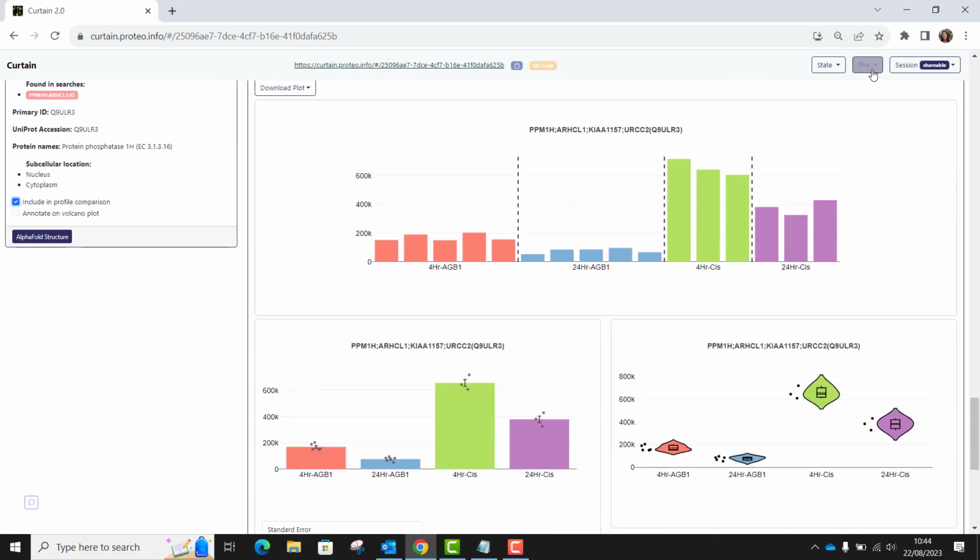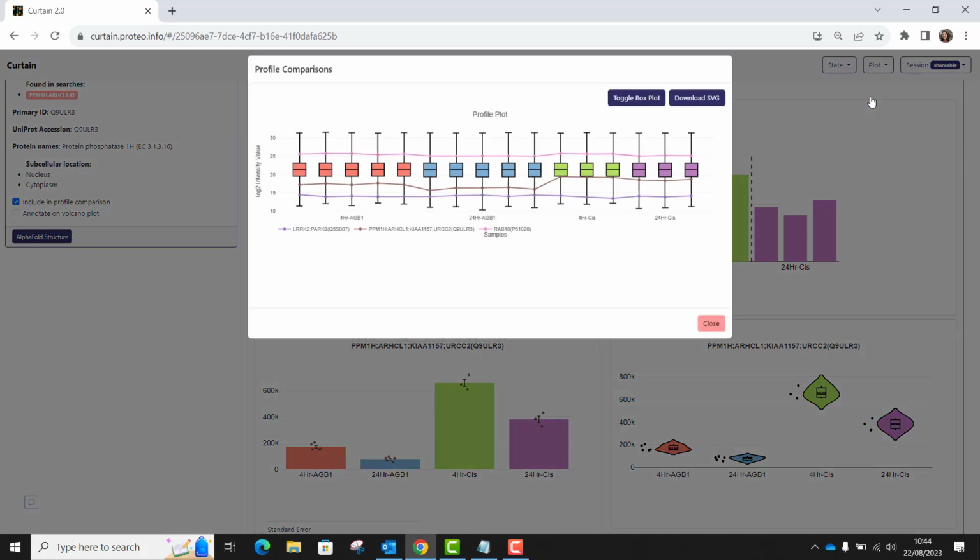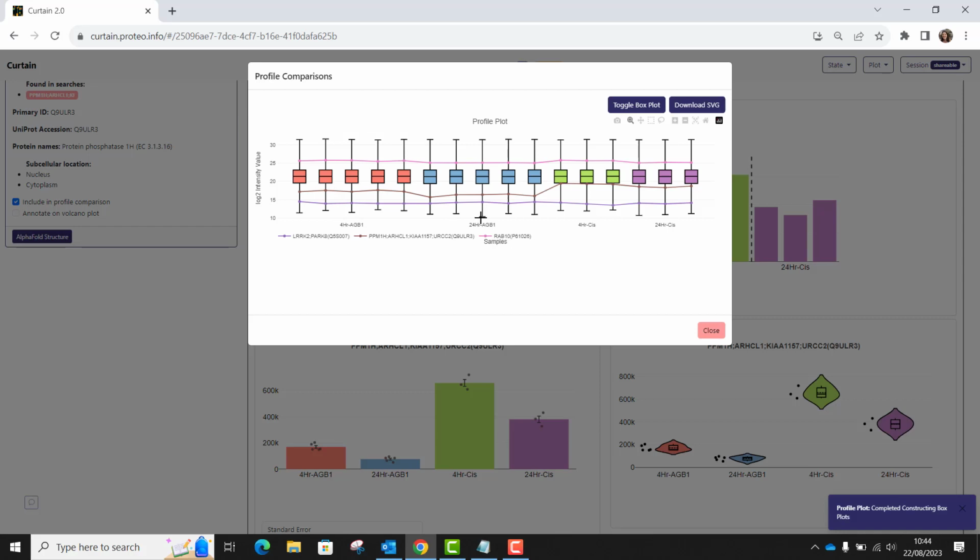Then if I go to Plot, Profile Plot again, you see that the intensities for these proteins have been plotted. You can see how this visualization helps compare and contrast proteins whose levels are changing and not changing between conditions. While the levels for ppm1H are changing with the AGB1 treatment, the levels for LRRK2 and RAB10 are stable, but you can also see that RAB10 is far more abundant compared to LRRK2 and ppm1H. So it allows you to appreciate those differences between proteins.